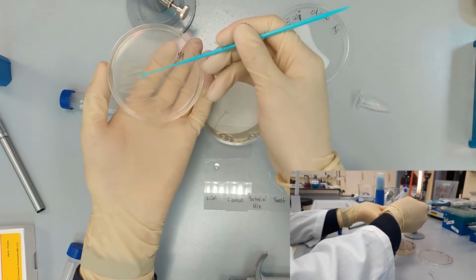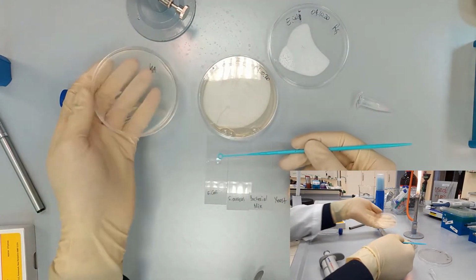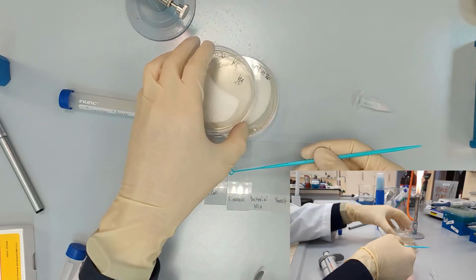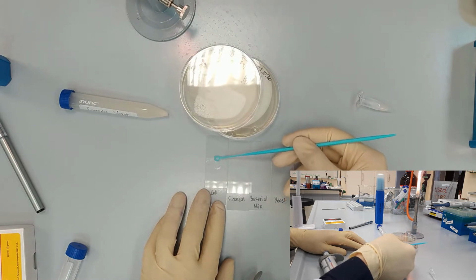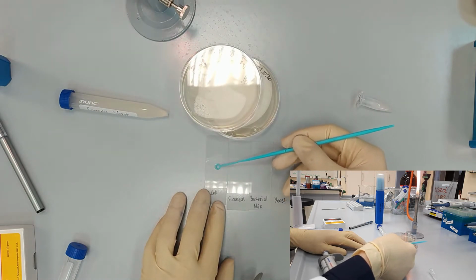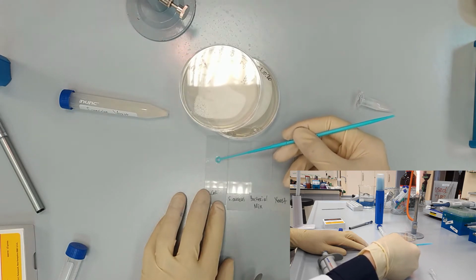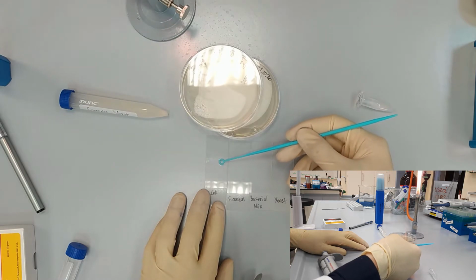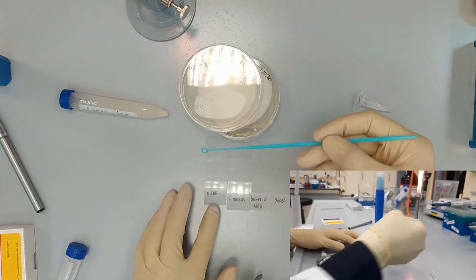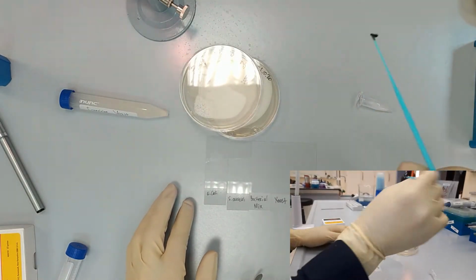So we take a small colony, and it is now on the loop, so we transfer it to the glass, and making circular movements, we just make this drop go a little bigger in diameter. So we usually take a 5 tenge rough area and we spread it like this. After that, we use burner to kill the bacteria.